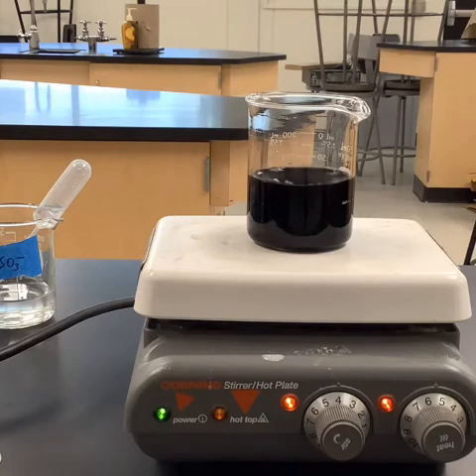All right, did you catch it? Hope so. I'm going to go ahead and record mine. I was a little twitchy on the trigger there. I kind of hit it, but it didn't go off too soon, thank goodness. All right, then we should have all of our data here. And so now we can start taking those times and turning them into rates. And we should be able to find the actual concentrations using that formula I gave you as well.